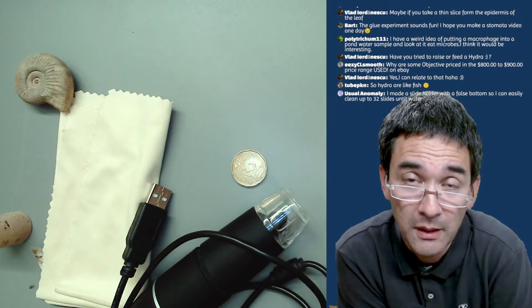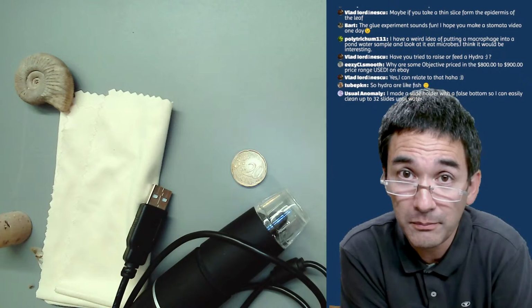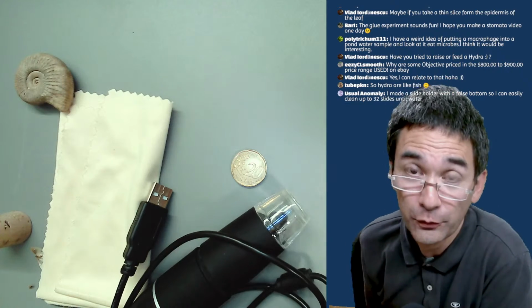Then I have to go to the used market. Basically the objectives are still good, and then you can charge almost anything, because I have to buy it because I need it for research.